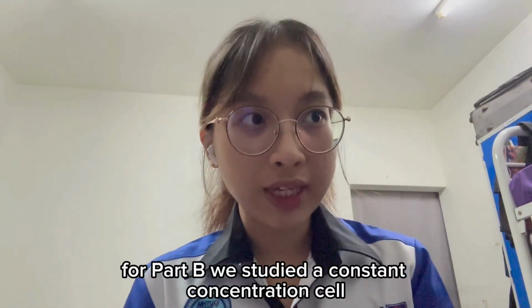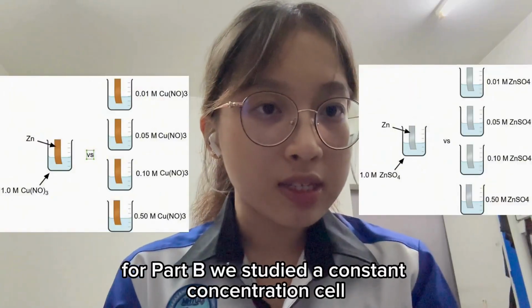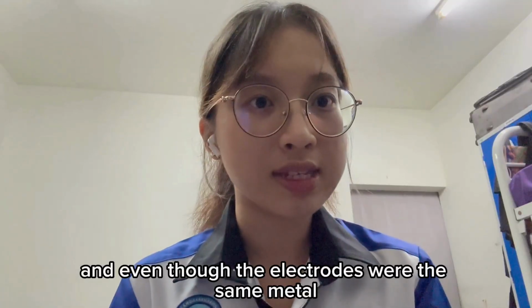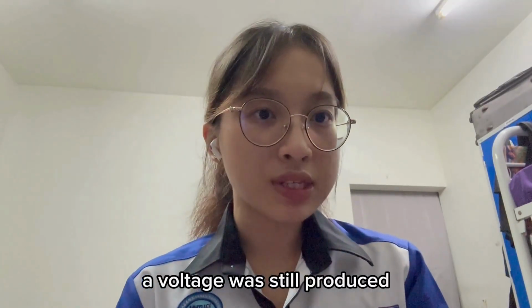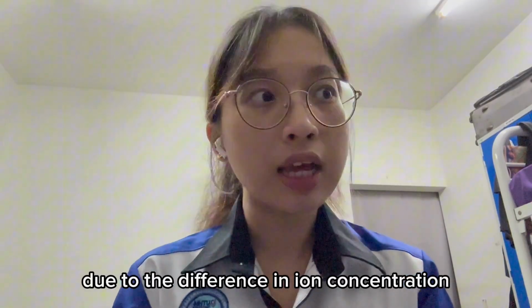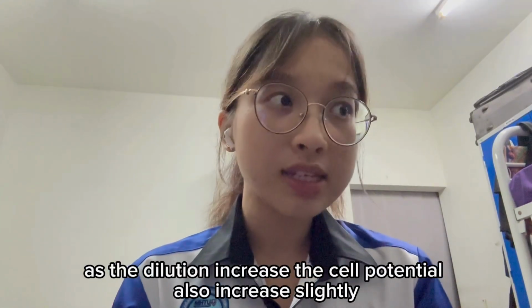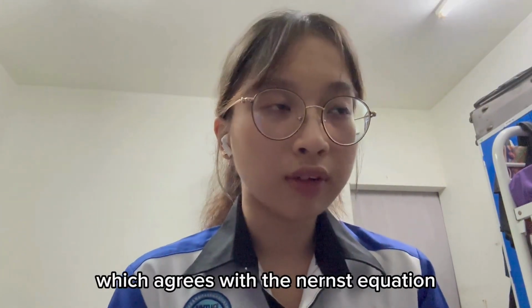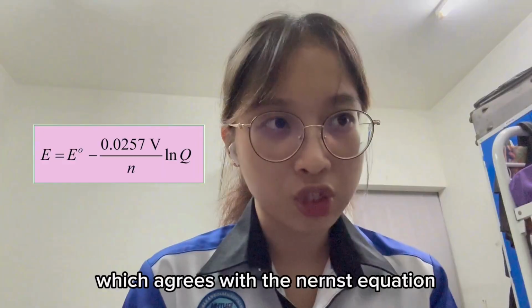For part B, we studied a concentration cell, and even though the electrodes were the same metal, a voltage was still produced due to the difference in ion concentration. As the dilution increased, the cell potential also increased slightly, which agrees with the Nernst equation.